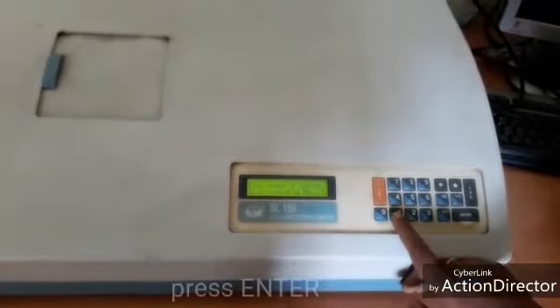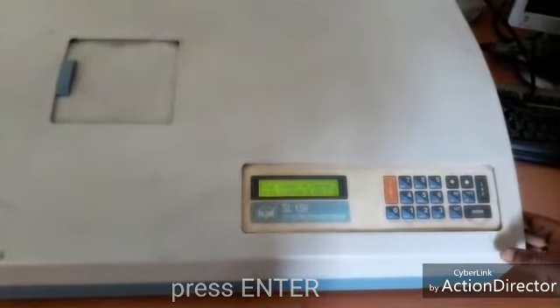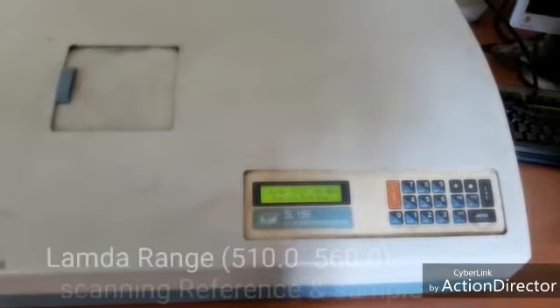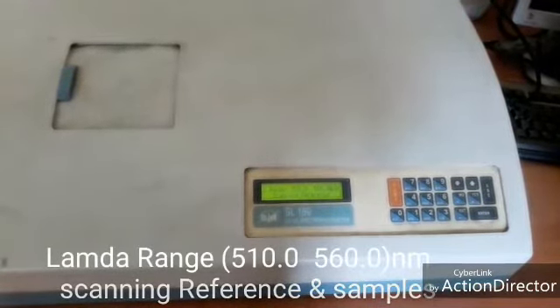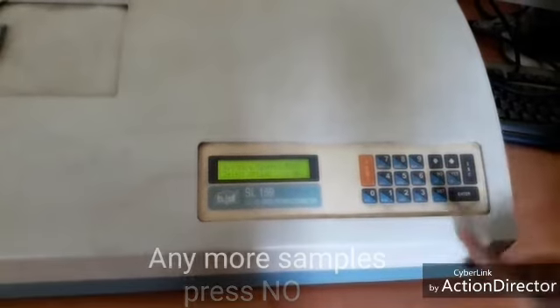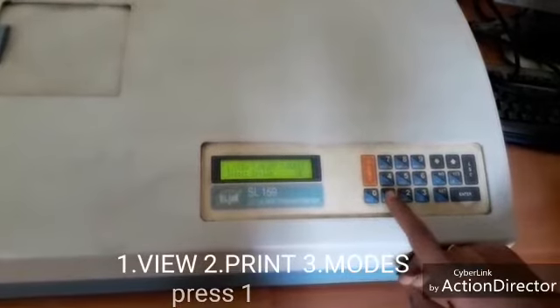Samples 1. Then enter. Again enter. Scanning reference and sample. Please wait some time. Any more samples? There is none, press no. Press 1. 1 is view.